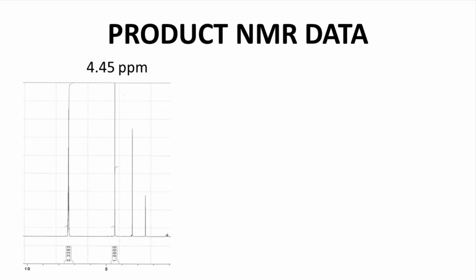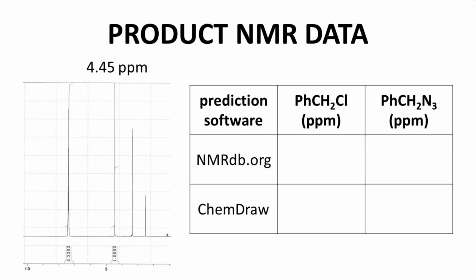Is this consistent with the product? Absolutely. Benzyl azide should have a CH2 singlet much like this signal. Is this spectrum consistent with the recovered starting material? Again, absolutely. Benzyl chloride should also have a CH2 singlet just like this one. Now, there's no reason to think that this reaction did not work. But as a scientist, I prefer to have some more evidence for the reaction's success than it's just got to be the right product. Some NMR spectra simulations are available for a quick check of expectations.